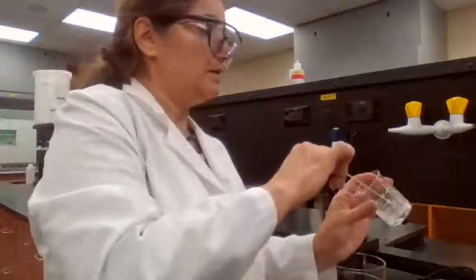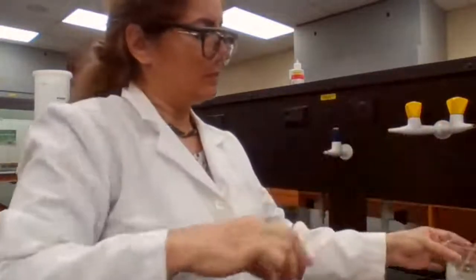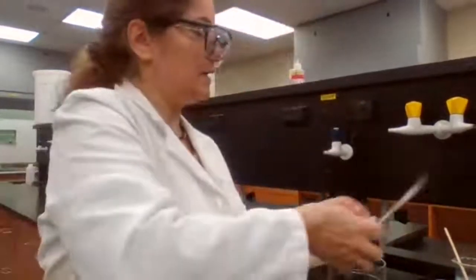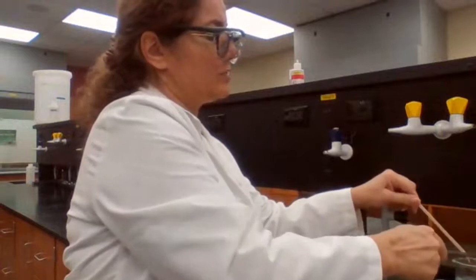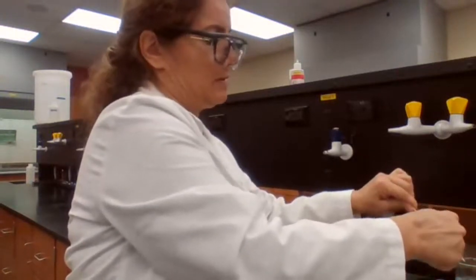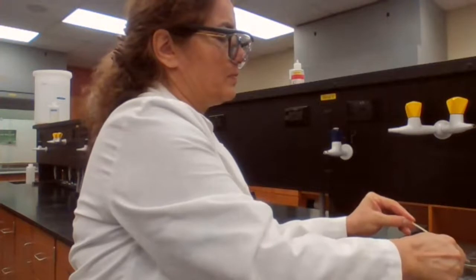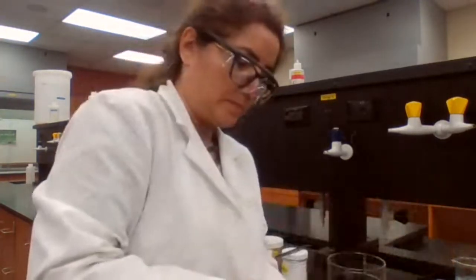The mass for the beaker with the organic neutral compound, we didn't have the wood stick in there. Now I have to take it out. Just have to scrape what is attached to it. Make sure it's clean and measure the mass for that. Okay.